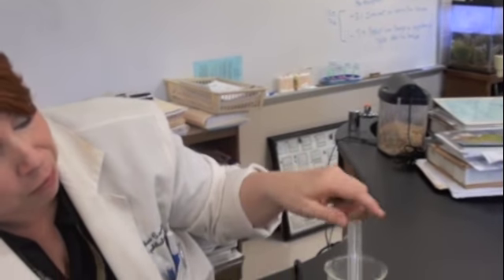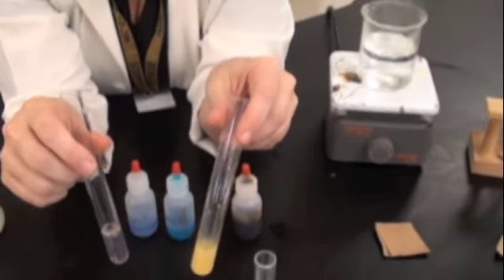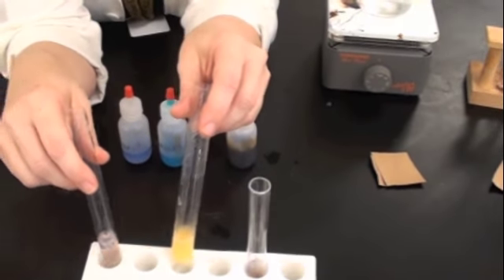So, let's recap. Did it contain lipids or fats? No. Did it contain starches? No. So it did definitely contain protein, and here we go. Simple sugars. And that would be the identity of the unknown, which in this case, I will admit, is dry powdered milk. Good job, Stu. So, now that you've seen the standards and you've done the unknown, you should now be ready to completely fill out and turn in your lab packet.